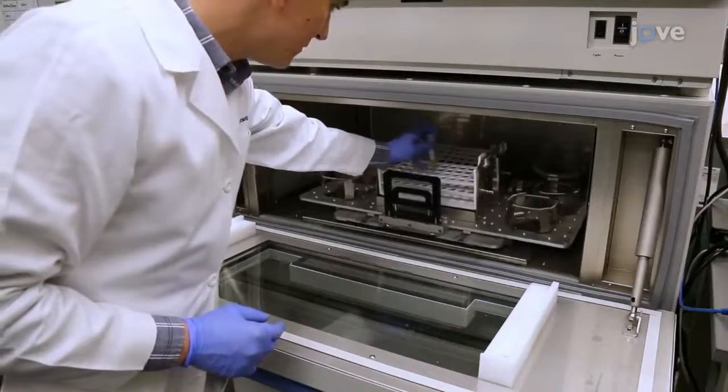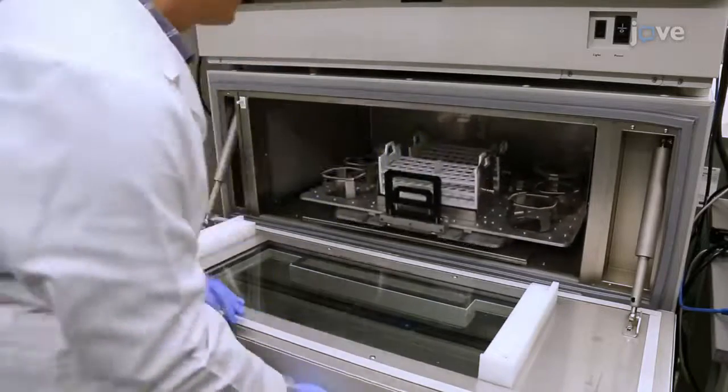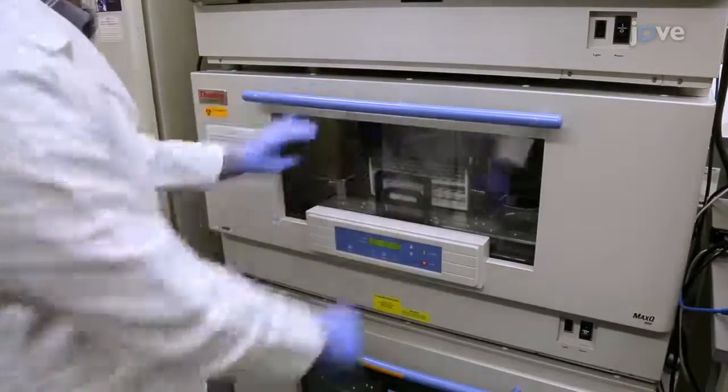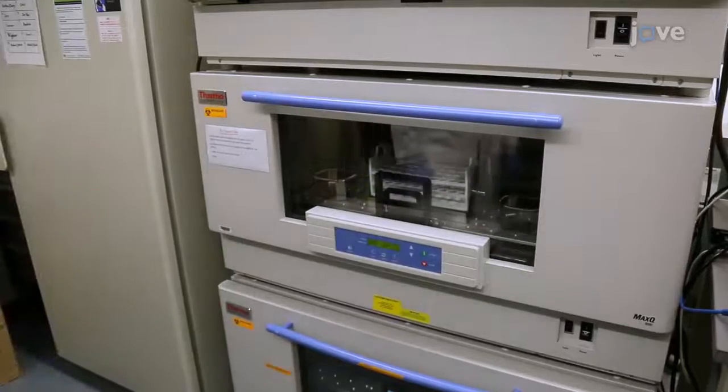Begin this procedure with preparation of antibiotic aliquots and the bacterial culture as detailed in the text protocol.